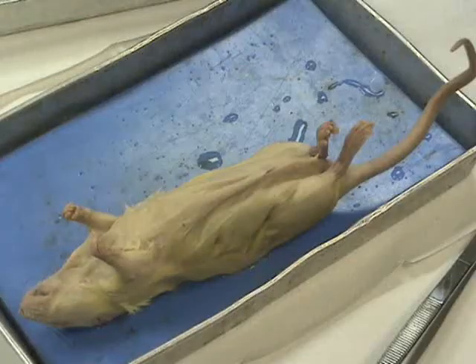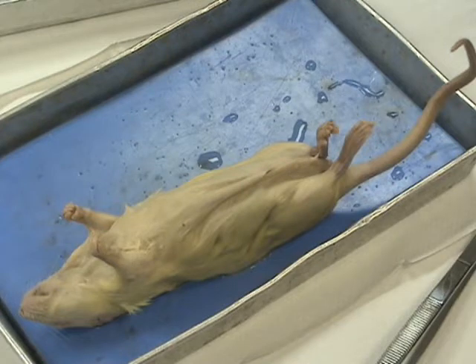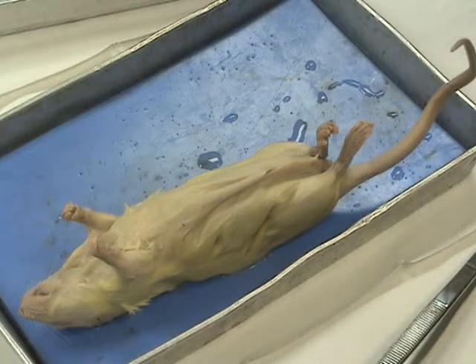Rat dissection. You've potentially picked up a sheet from your teacher at this point. If you haven't, there are a few items that you need to take care of, one of which is that you'll need to list some body systems and define some terms such as homeostasis and characteristics that all mammals have. Short of that though, there are some things that we want to show you today on the rat.